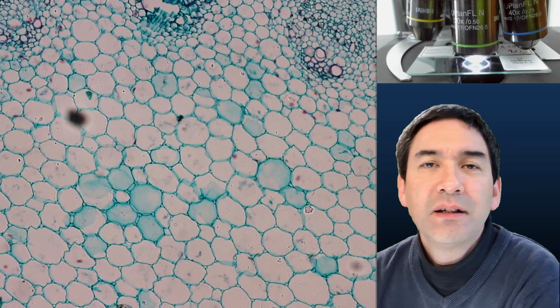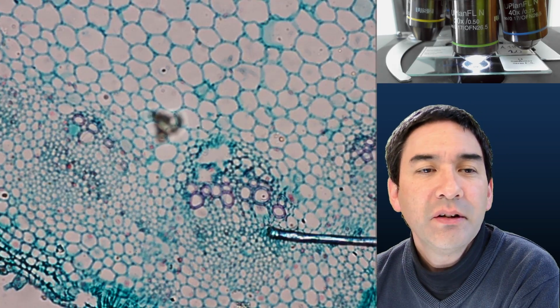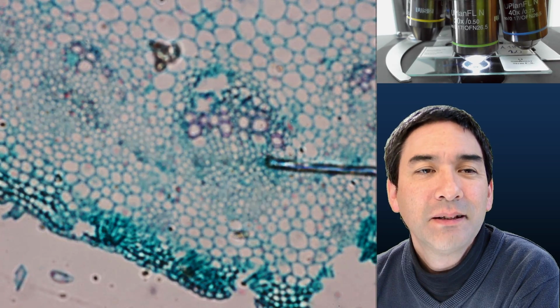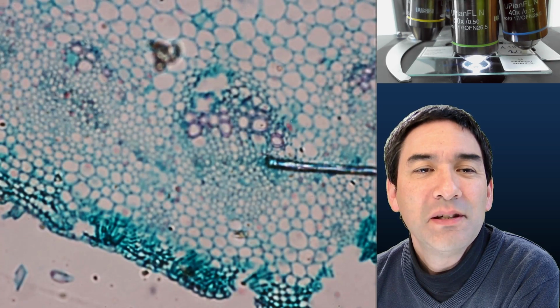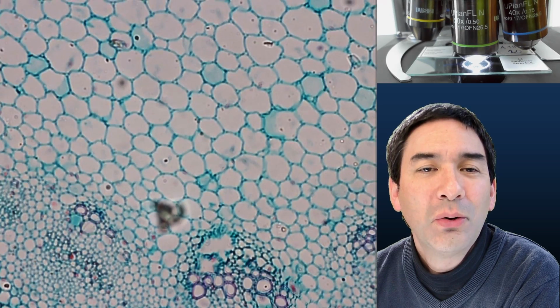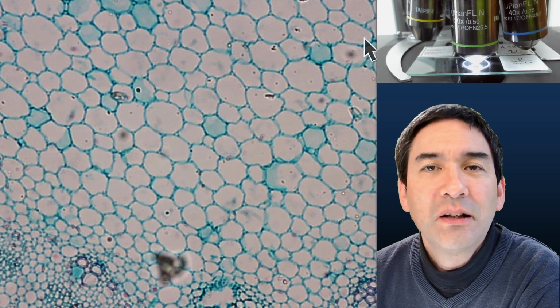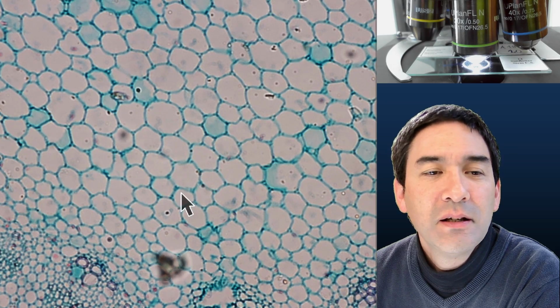You can see that the specimen looks much thinner. And there is also another little difference that you're able to probably realize, and that is that the slide itself is a little bit dirty as well. So you see that this dirt seems to be sticking on the slide, but indeed there is a little bit of dust also beneath the cover glass. Just wanted to show this to you as well. Yeah, you can see over here all of those little dots. These are a little bit of contaminating dust.